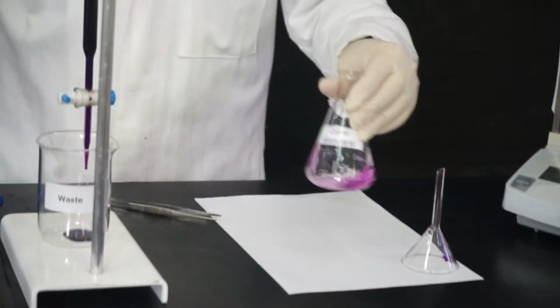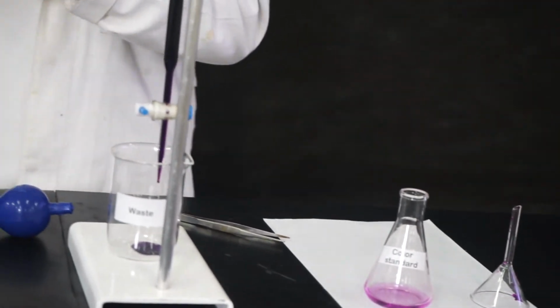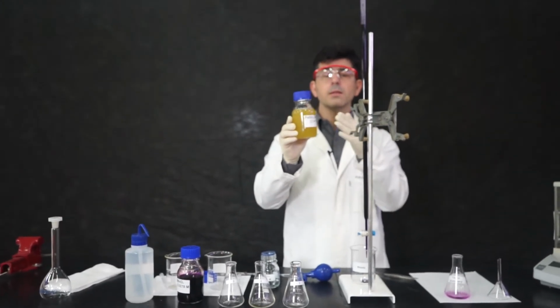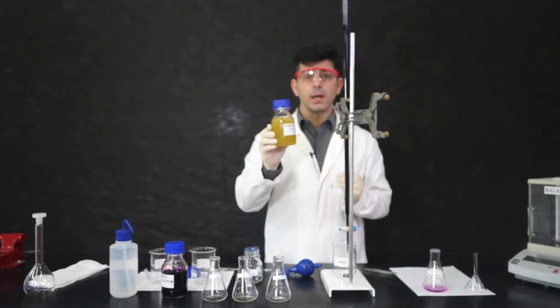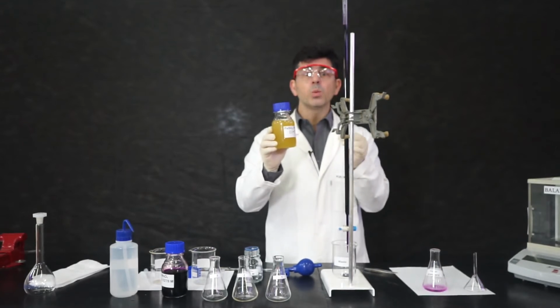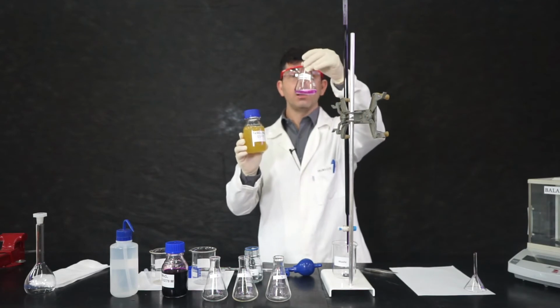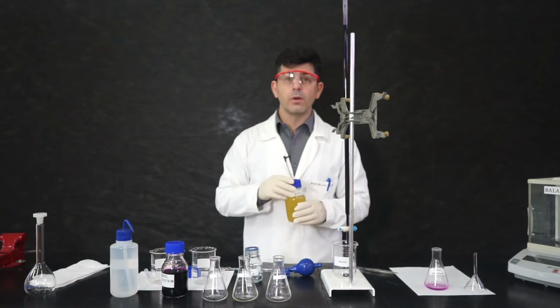When you do this, we get the color. So let's understand. The iron is yellowish. Potassium permanganate is purple. As potassium oxidizes the iron, the oxidation will discolor the permanganate. The moment I reach the end point, if I add 1 extra drop of potassium permanganate, I'll be in excess. And then we will see this color. This is when we have to stop the titration and annotate the volume.